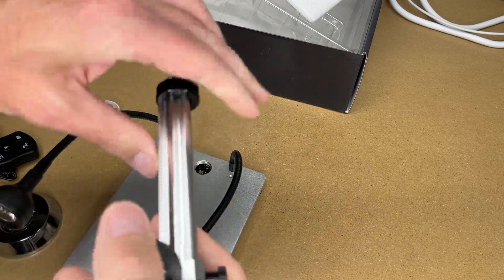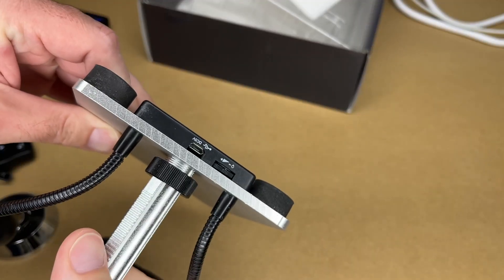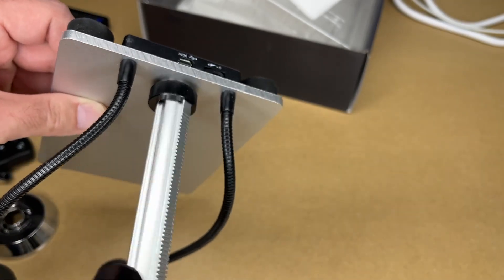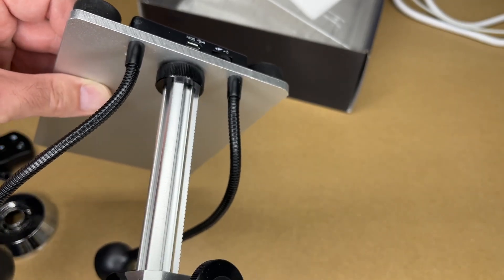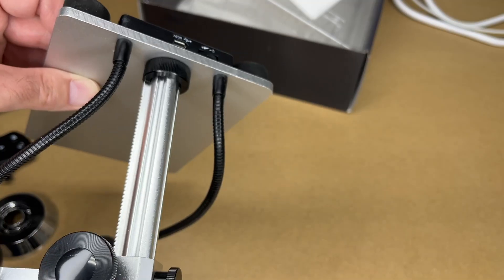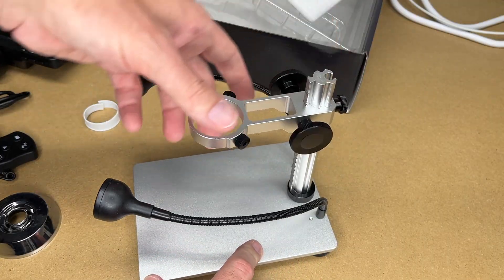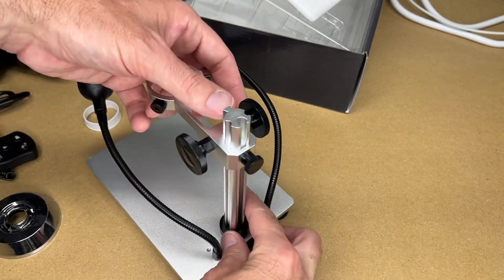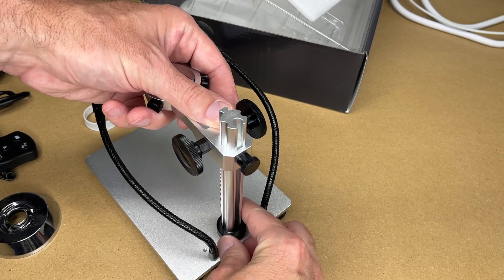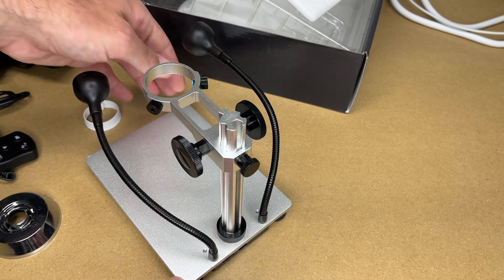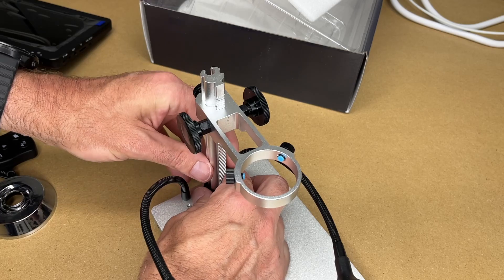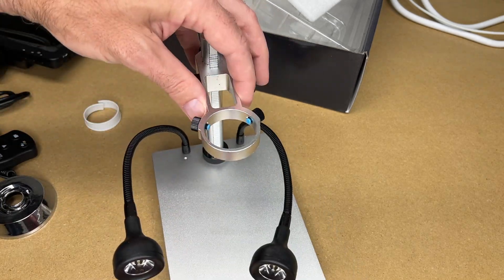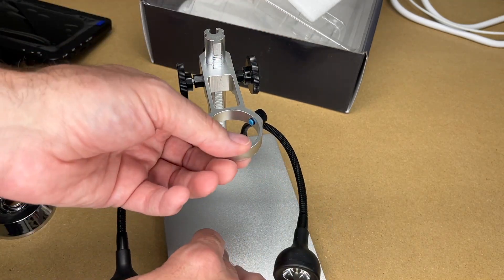So let me get this set up. This is going to screw into the base here. So I'll thread this in as far as it will go. So you can see that is backwards. So I'll turn it to where I want it to be and then I can tighten this nut down against the base. So that would be a jam nut and that will tighten that in place. So now this is very sturdy here.